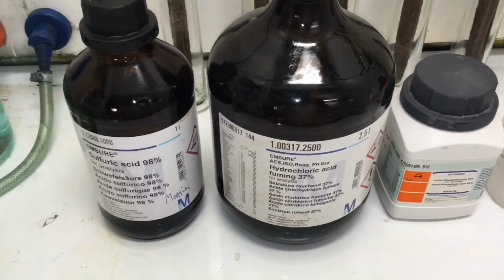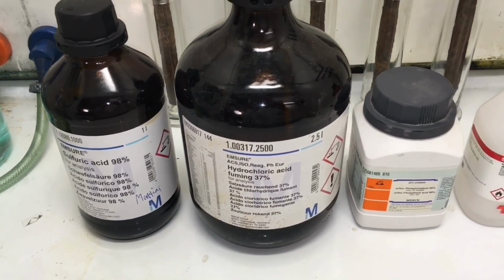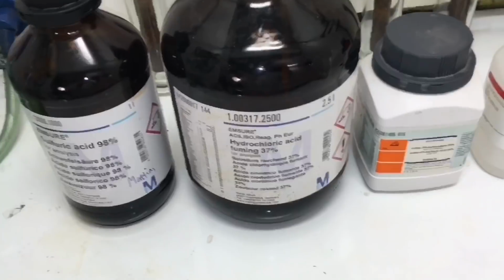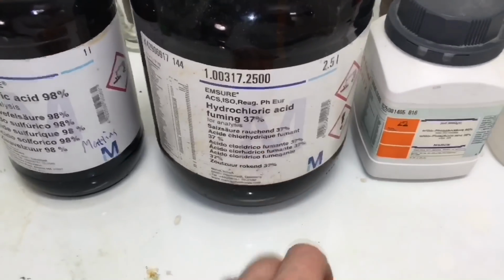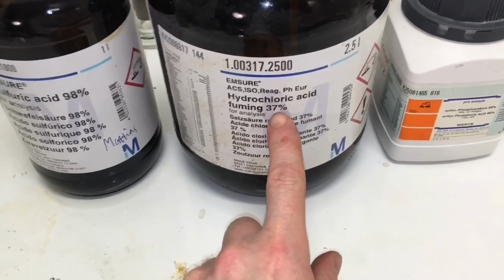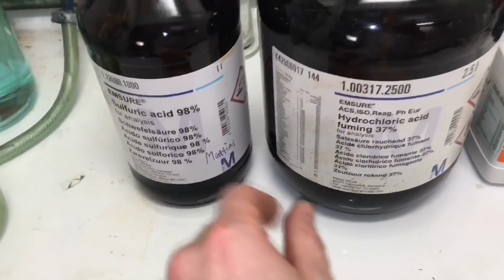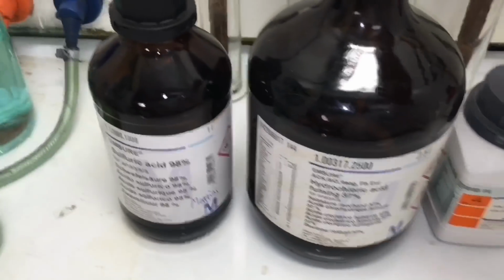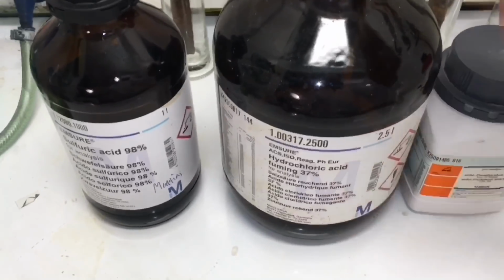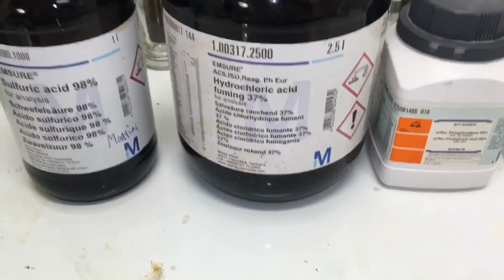So to make this comparison as accurate as possible, I have calculated that I should use approximately 30% concentration of these different acids. This is based on the fact that this hydrochloric acid, which is a gas, can only be dissolved at its maximum at 37% in water, while you have 98% in a water solution over there. So this is mostly pure acid. You can actually feel that also if you lift them. This entire bottle, well, it's only actually half full, but it weighs much less than this bottle. It's really heavy. So I'm going to dilute it down to 30%.